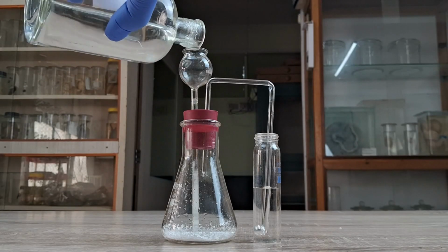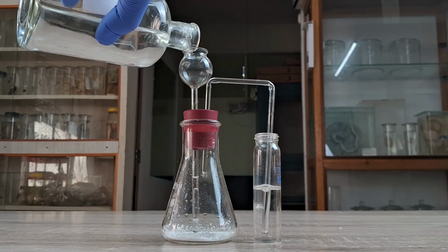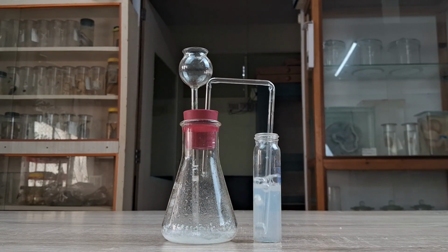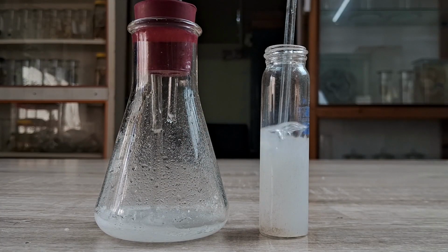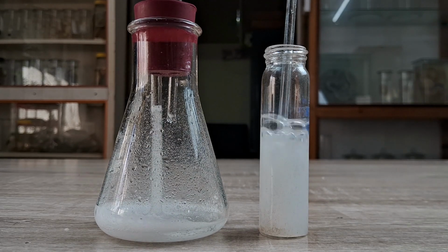When the gas evolved by sample D with the acid was allowed to pass through the lime water in the test tube, the gas turned the lime water milky. When more of the gas was bubbled through the milky lime water for several minutes, it was also observed that the lime water became clear and colorless again.